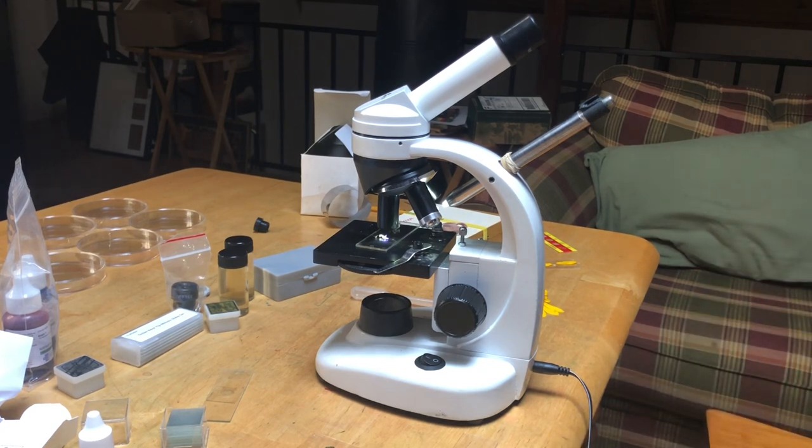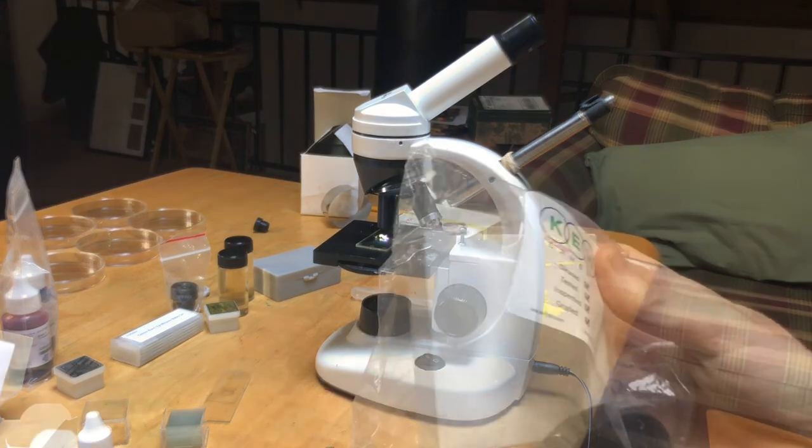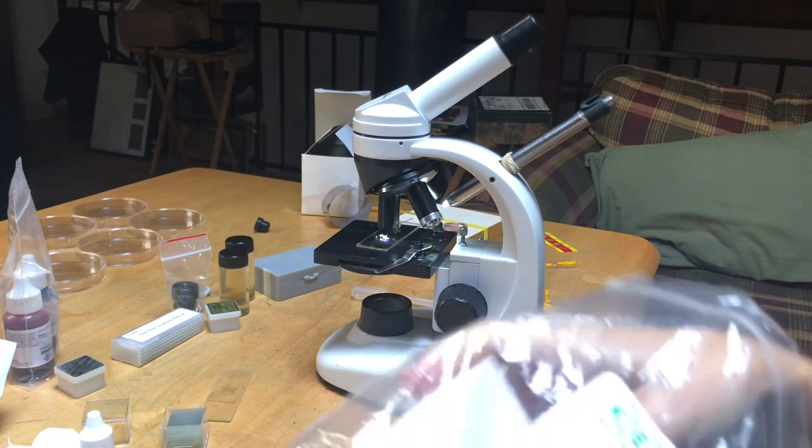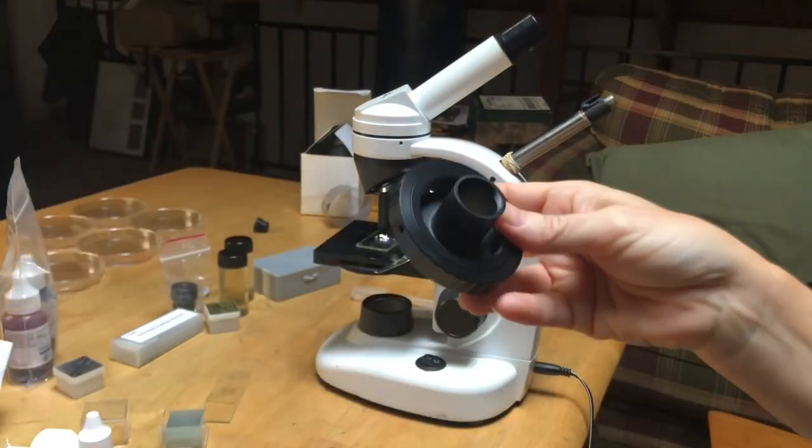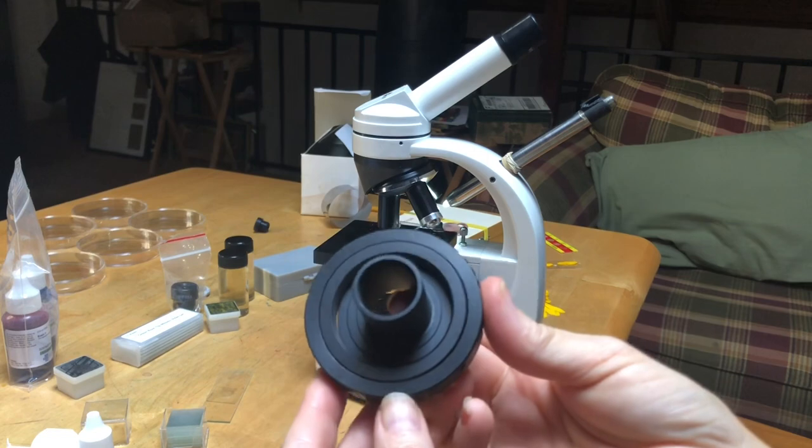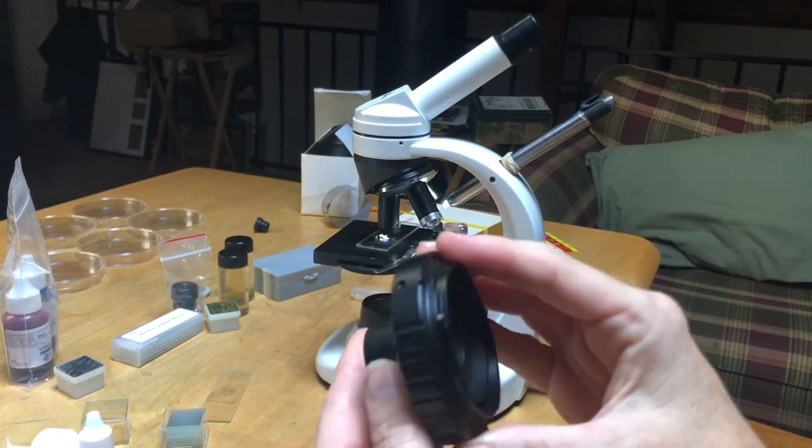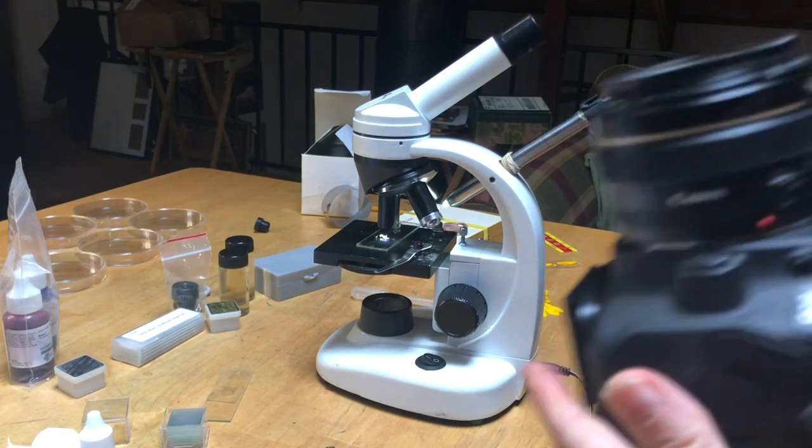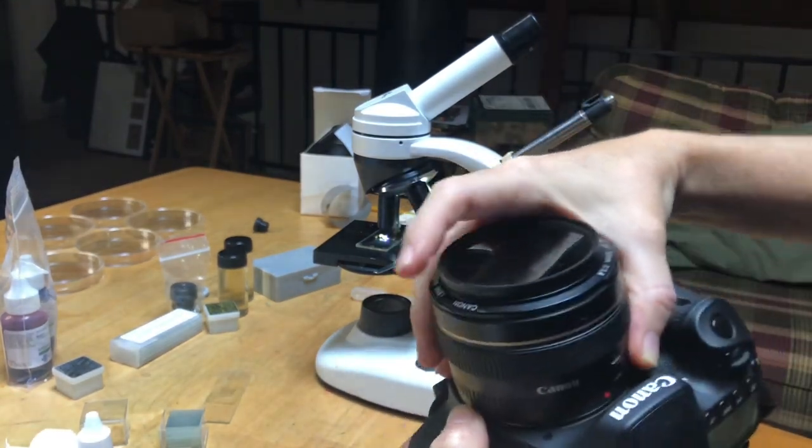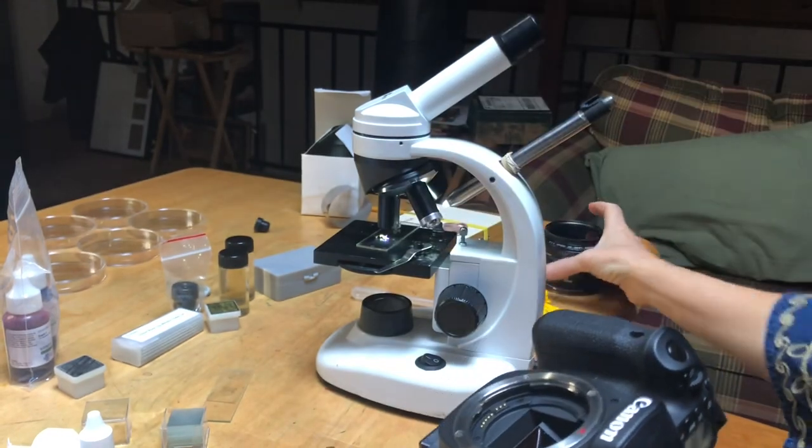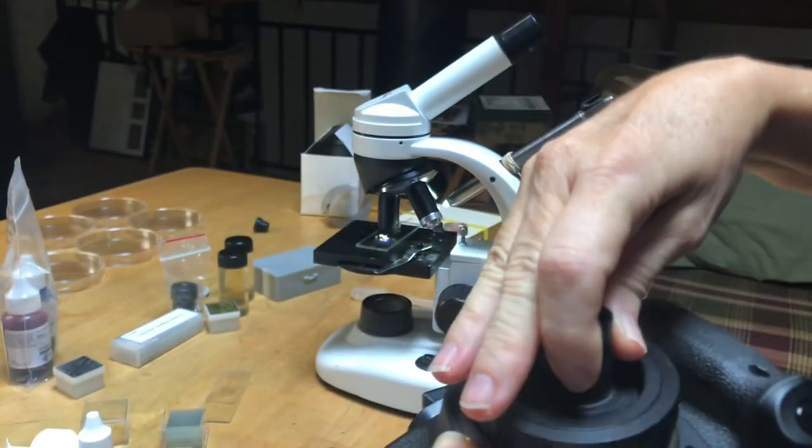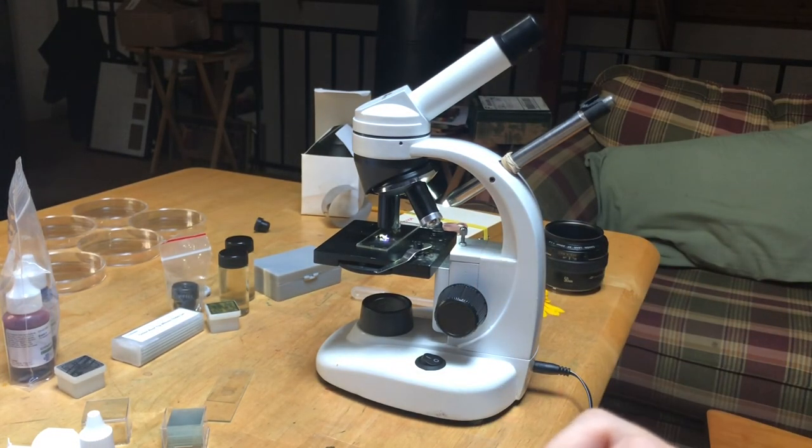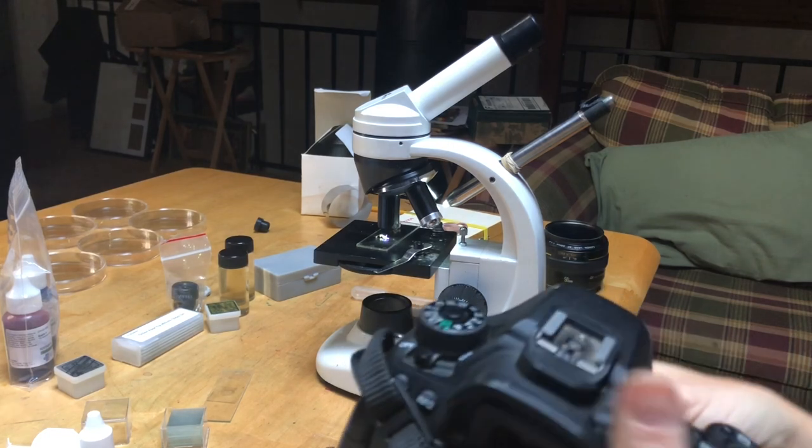So let's set up the DSLR. Some time ago I purchased a kit, an adapter that allowed my DSLR to hook up to microscope or my telescope. So if you have a DSLR, you can take off the lens of your camera and you can attach this in the same way that you would a camera.